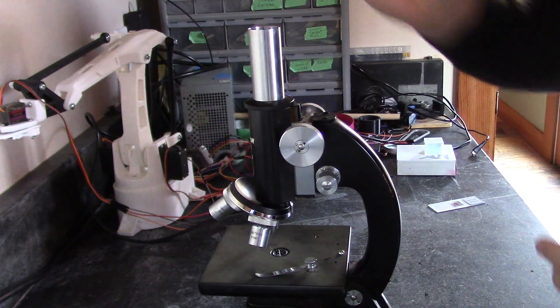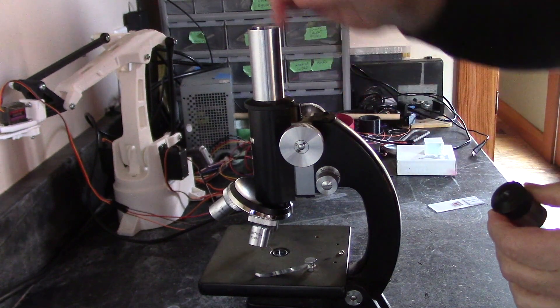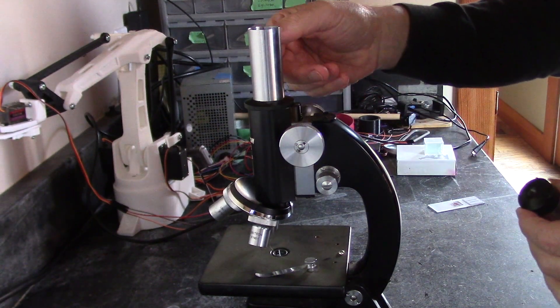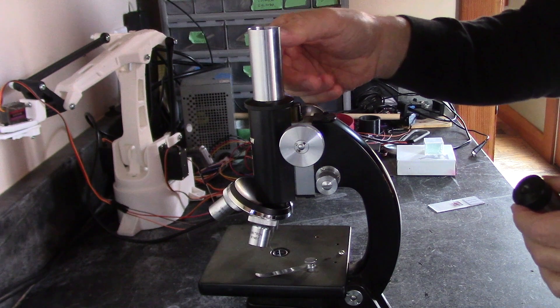So what I'm going to do today is I'm actually going to take the eyepiece out and I'm going to use the prime focusing on my camera to make it work.